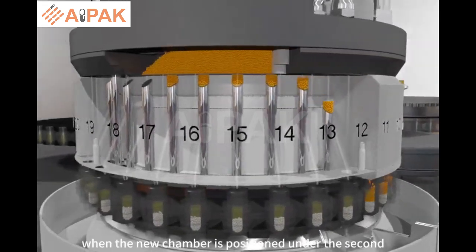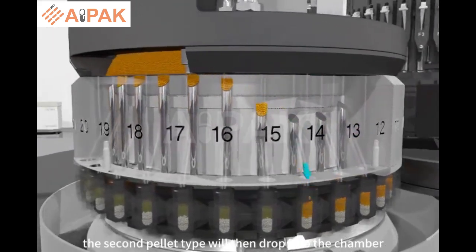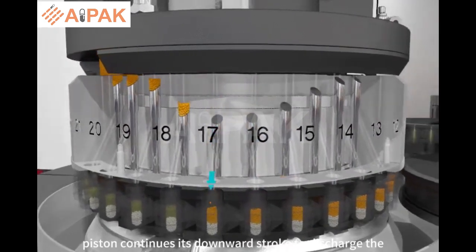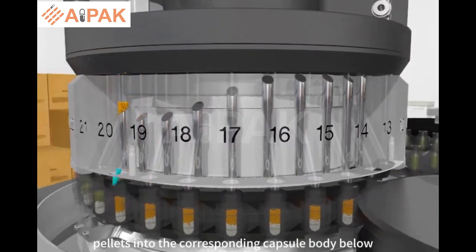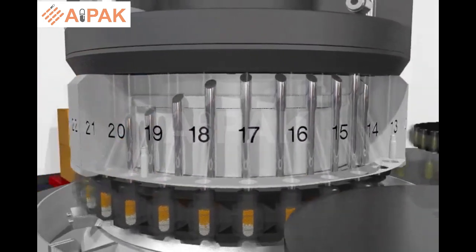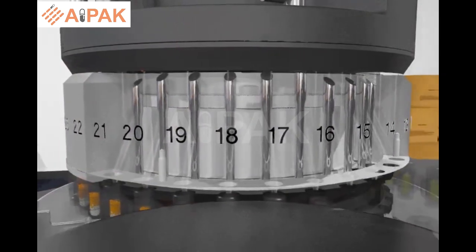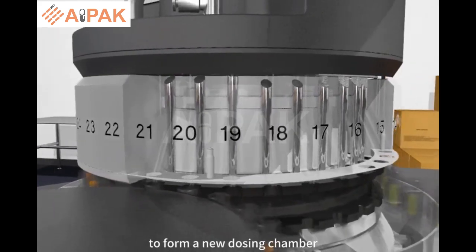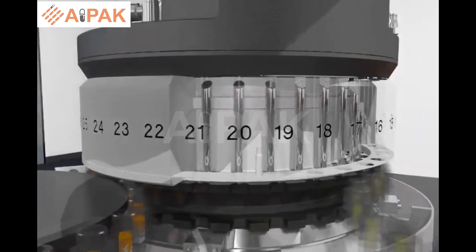When the new chamber is positioned under the second sector container, the second pellet type will then drop into the chamber. The dosing piston continues its downward stroke to discharge the pellets into the corresponding capsule body below. The dosing piston then moves up to clear the chamber area, and then moves down again to form a new dosing chamber as the dosing cycle begins for the next capsule.